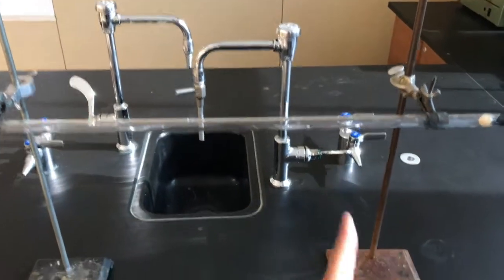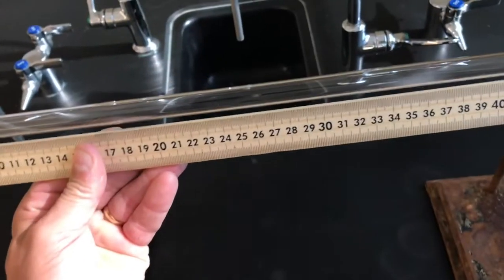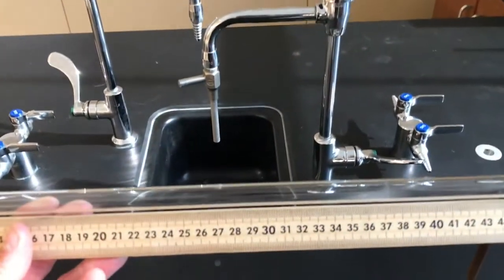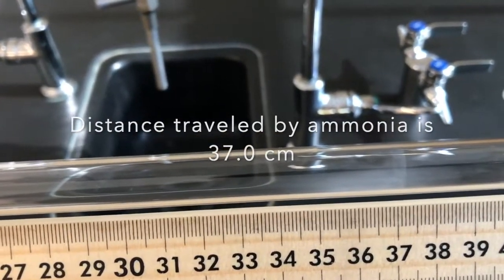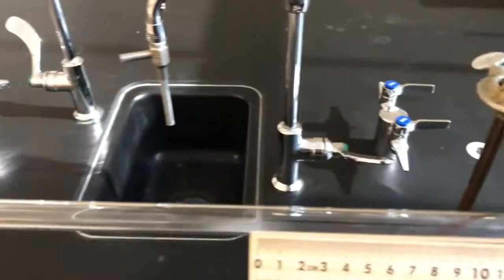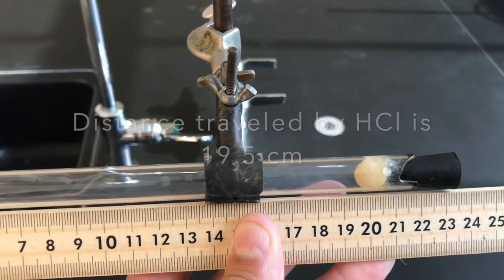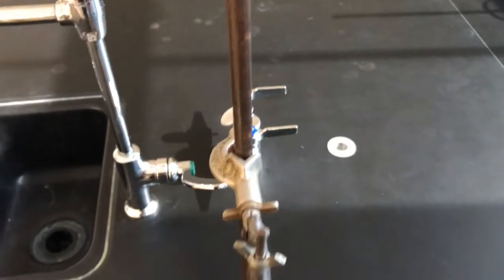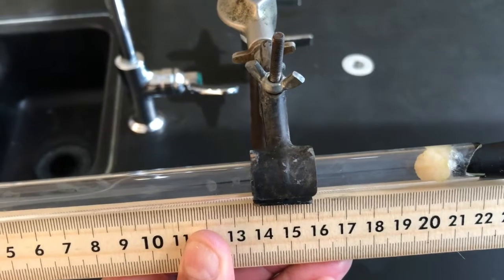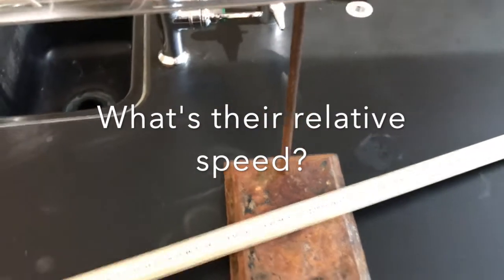So you can tell ammonia's to the left. Let's measure these distances. It looks like it's 37 centimeters from the ammonia side, and 19.5 centimeters from the hydrochloric acid side. So 37 and 19.5 — you should read the ruler to the tenth place. So figure out how much faster ammonia is.